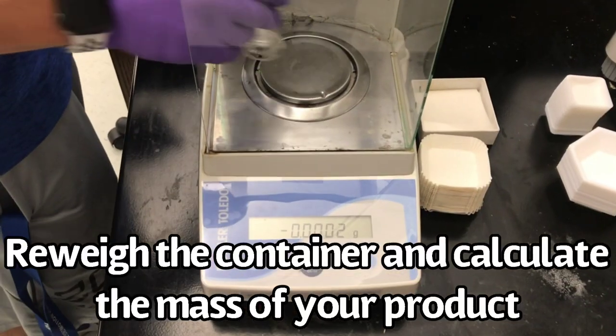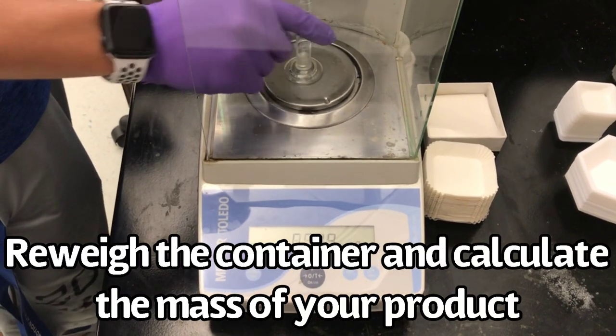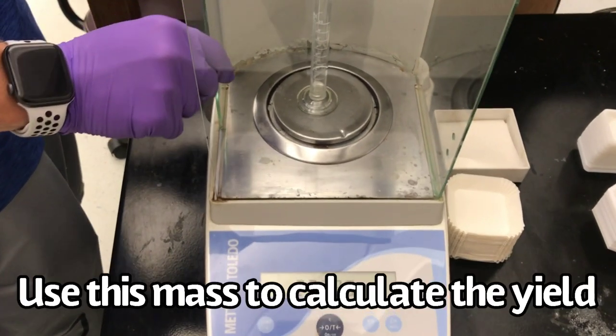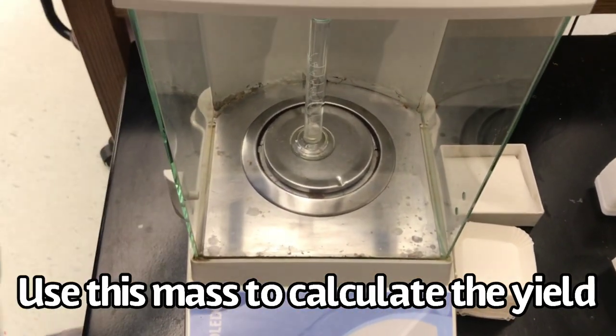Re-weigh your container and calculate the mass of your product. Then use the mass of your product to calculate the yield.